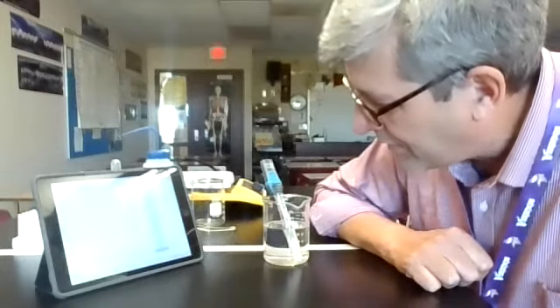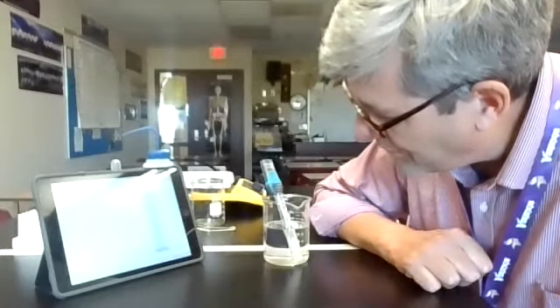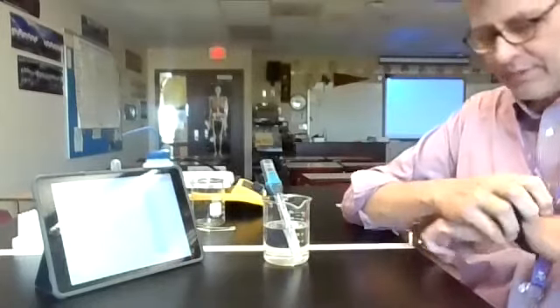And I do like that it sort of flips over on its own, saves us doing a little extra work there. And our curve is flattening out. Really works pretty darn well. We're down to 29 point some degrees Celsius, so we're going to try and get down to 20, and then I think we'll stop it. Should only take another minute or so.